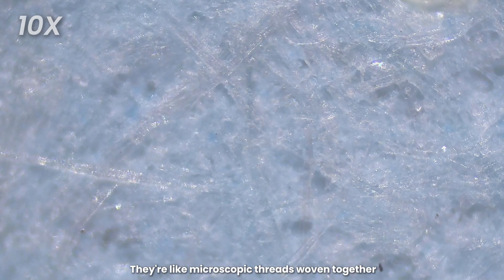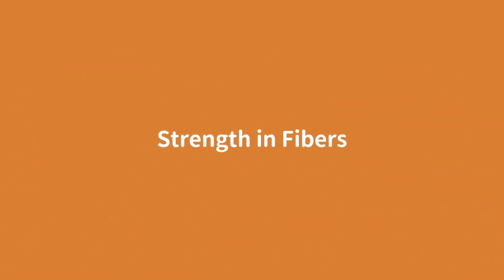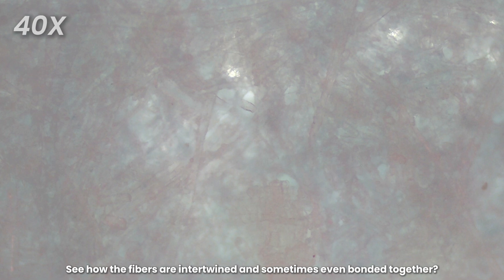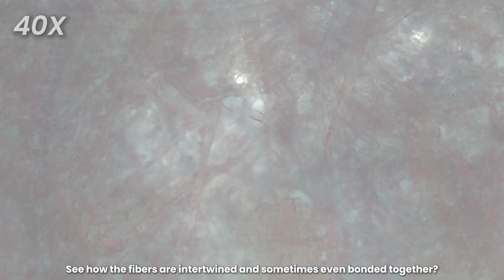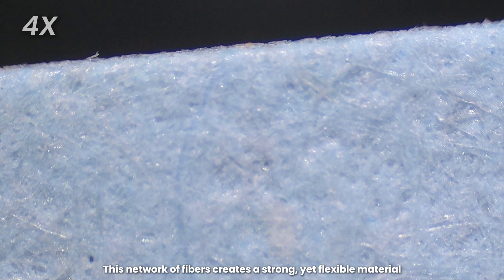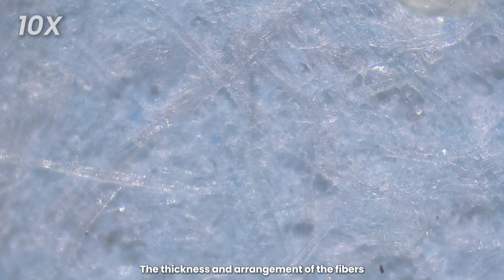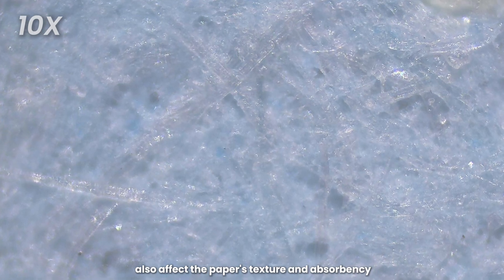They're like microscopic threads woven together. See how the fibers are intertwined and sometimes even bonded together. This network of fibers creates a strong yet flexible material. The thickness and arrangement of the fibers also affect the paper's texture and absorbency.